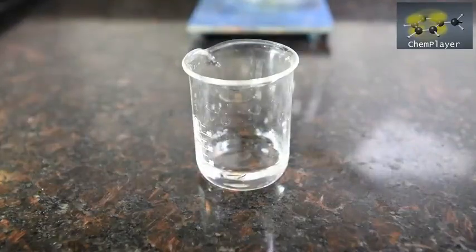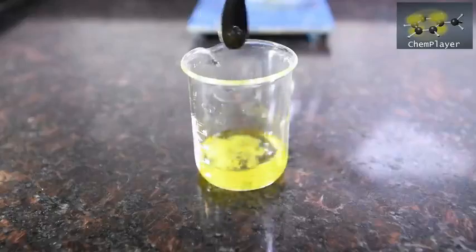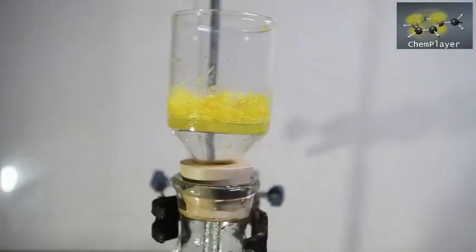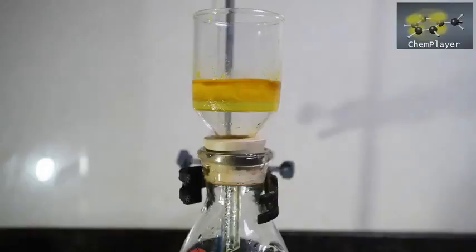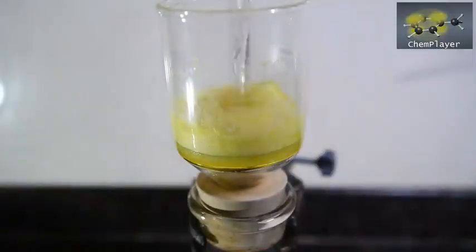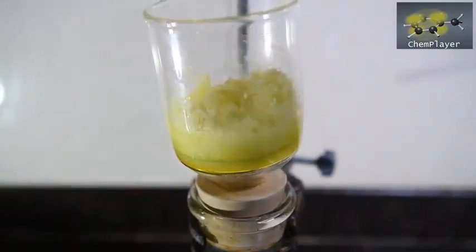The product is still a yellow color and has a slightly bad sulfur smell to it, so we figured we'd experiment and see if we could clear this up. A little test using absolute ethanol in a beaker shows that the yellow color does seem to wash out in the ethanol without dissolving the crystals, so let's try this on the product in the filter. The color looks like it's coming out, but there's a side effect: the nice crystals we had appear to be changing form in the ethanol, very likely dehydrating as the water is sucked out. We may as well go all the way and wash with more ethanol to see if we can get a decent product.